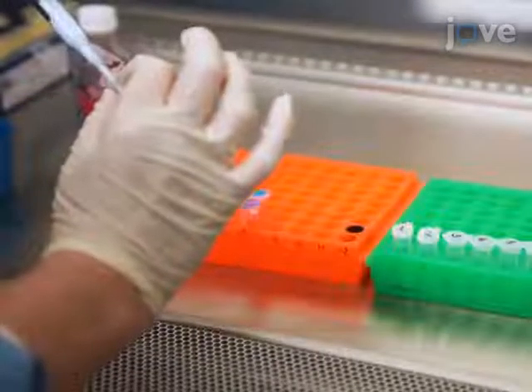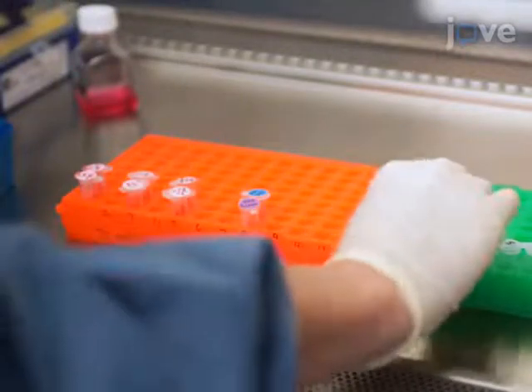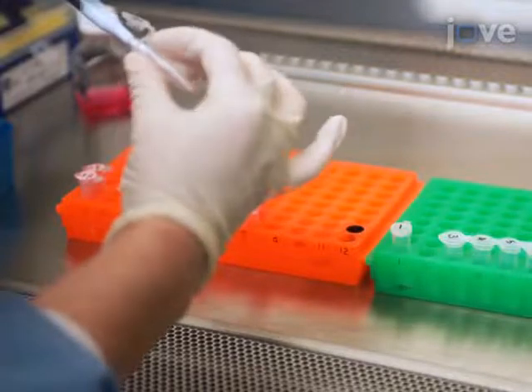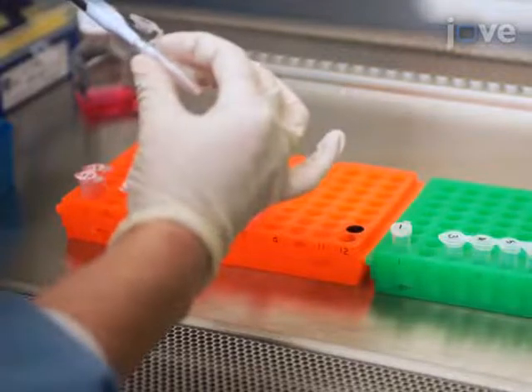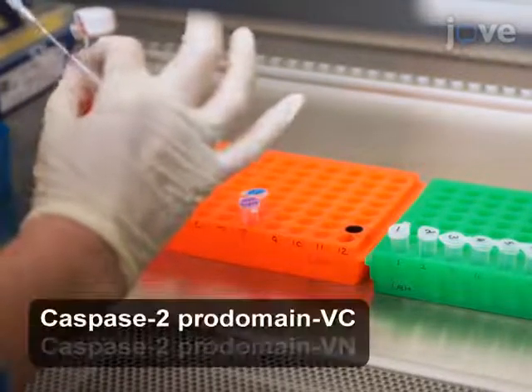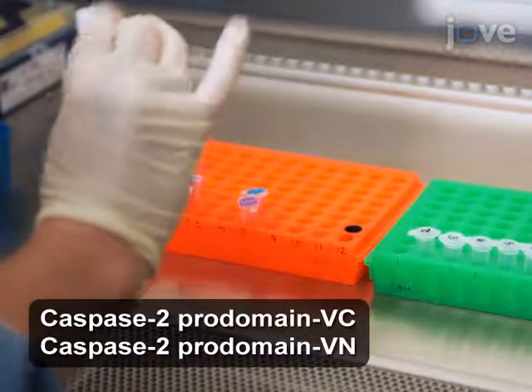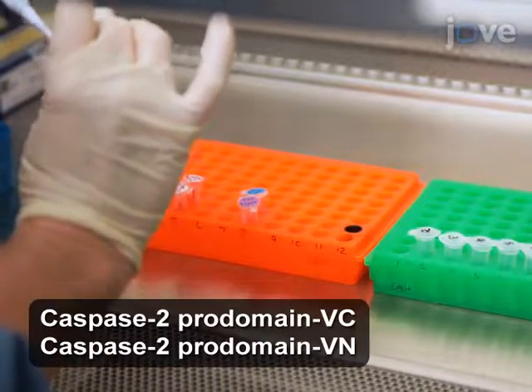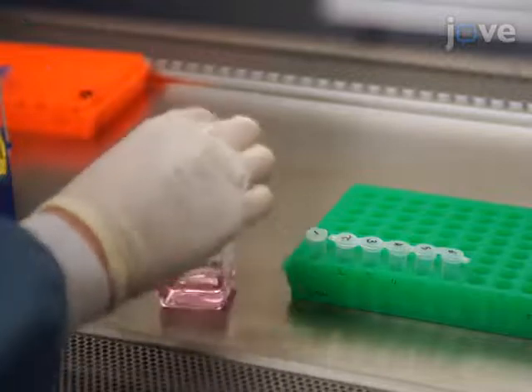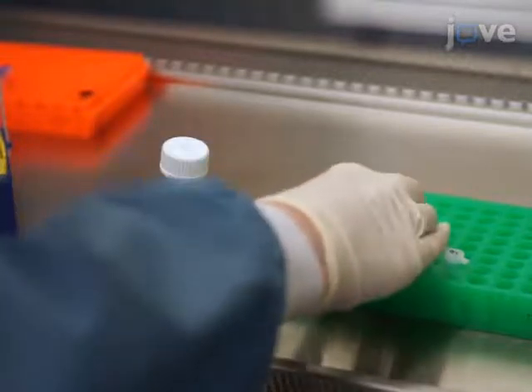Then add 10 nanograms of a reporter plasmid to a sterile 1.5 milliliter tube for each well to be transfected. Add 20 nanograms of each caspase BiFC plasmid to each tube.